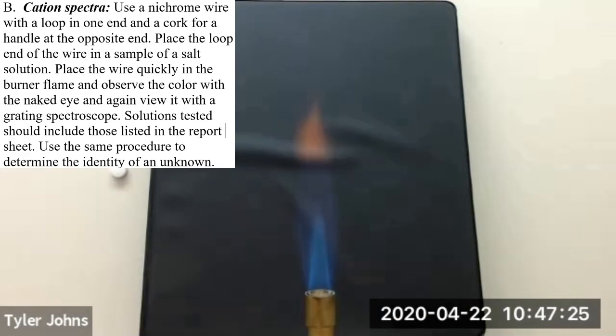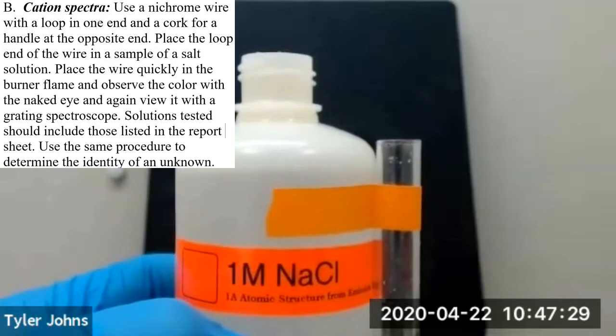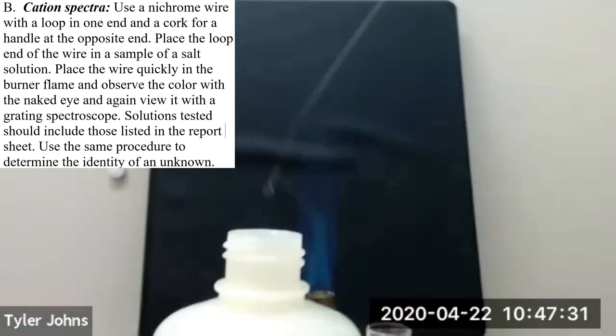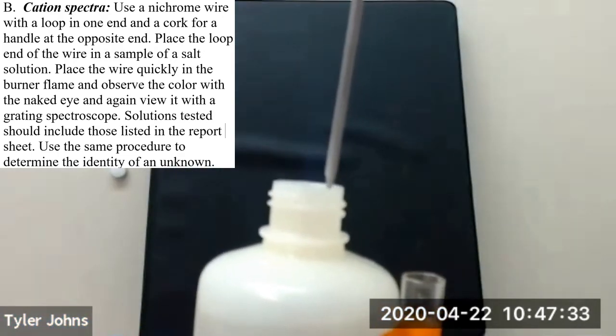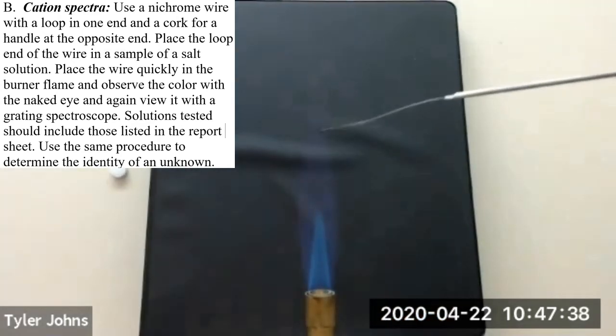The second cation spectra we'll be looking at is sodium. So we'll take our sodium chloride salt solution, insert our nichrome wire, and place it in the flame.